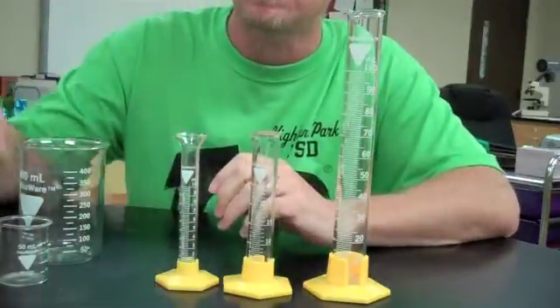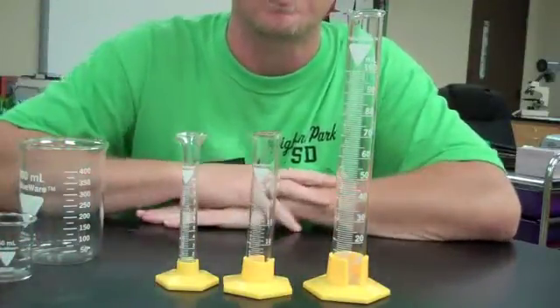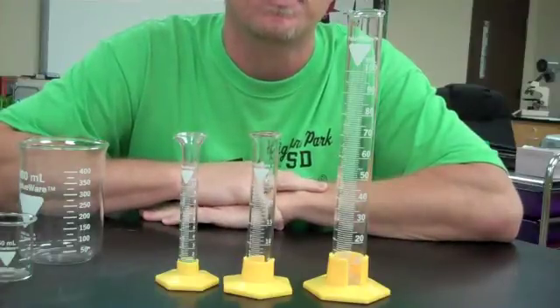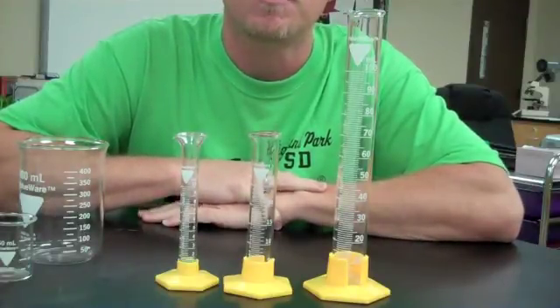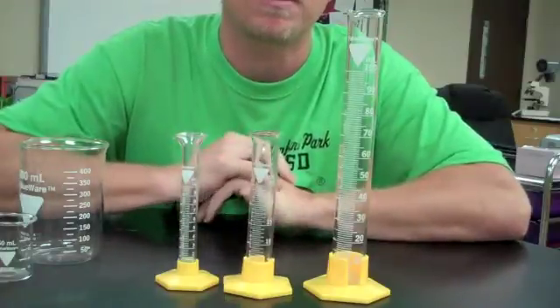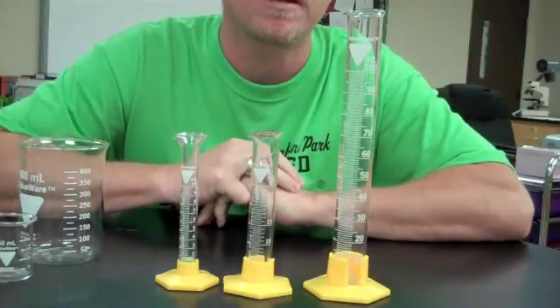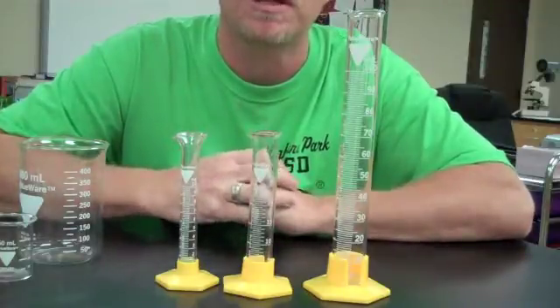All these graduated cylinders and beakers are used to measure the volume of fluids, and sometimes even some chemicals if we're using powders. But generally we use glassware like this to measure solutions, dissolved substances, and reagents and products that we use within chemistry.